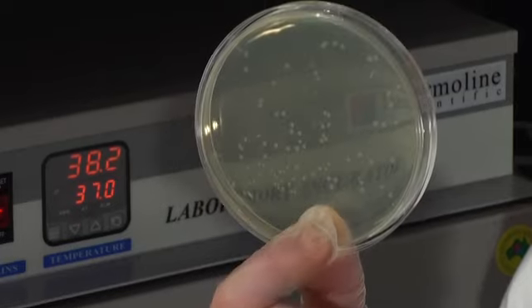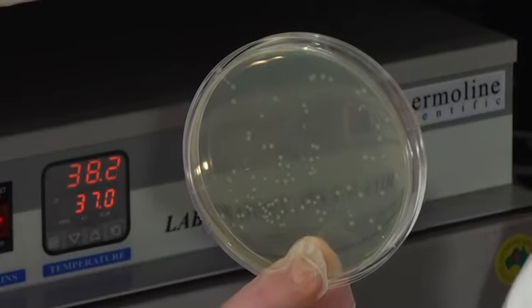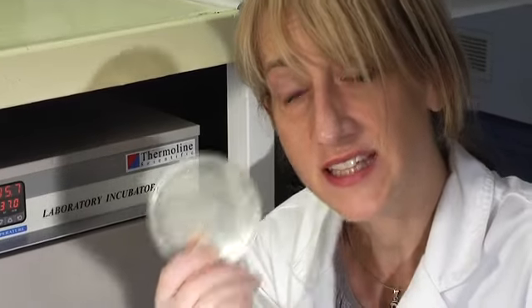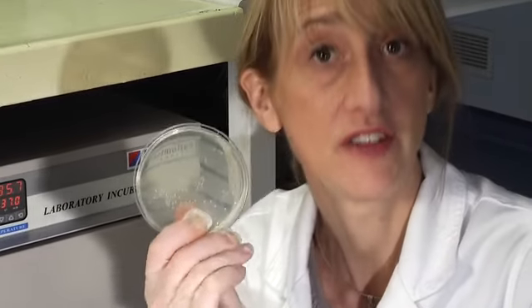Something's grown! And as it's the plasmid that contains the antibiotic resistance gene, only bacteria that contain the plasmid have grown overnight.